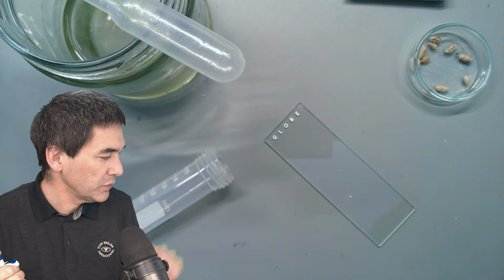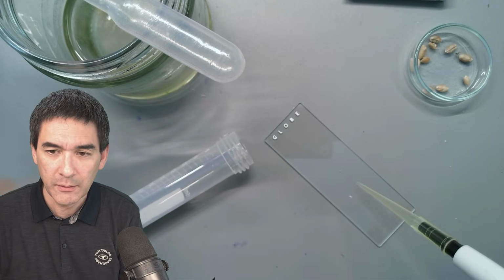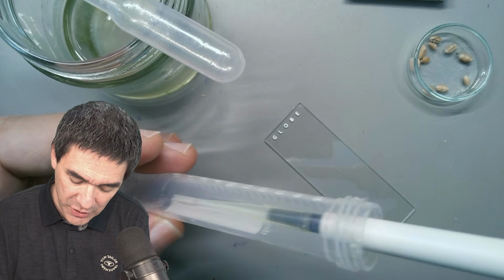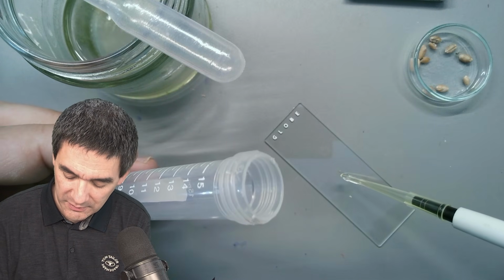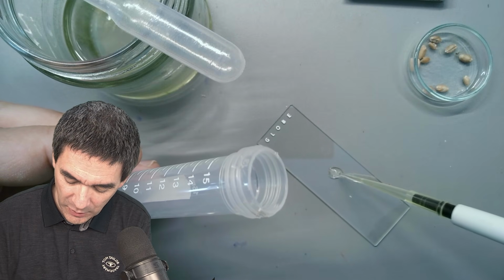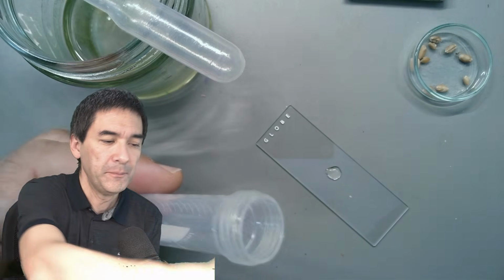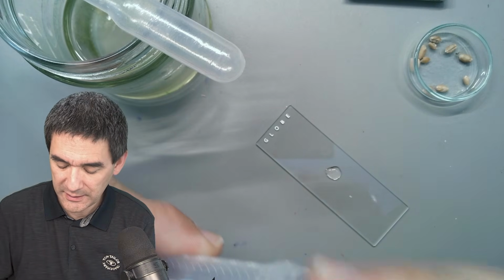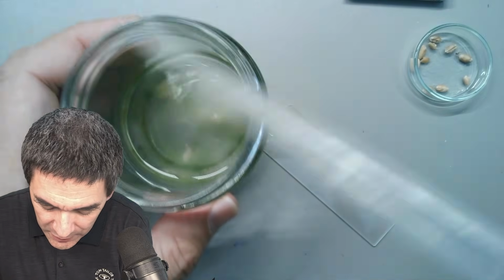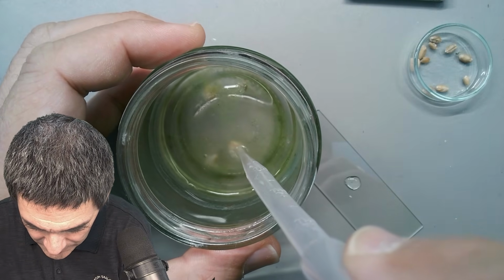So what I'm going to do first is take a pipette and simply put a small amount of this on my slide. Sometimes you don't even need a pipette because it's so viscous that some of the stuff will just stick to the tip. Yeah, look, that's almost like a gel, right? It's probably already more than you need anyway. Okay, and let's now add again a small sample here. I'm going to go directly into the specimen again, just to collect a larger amount.